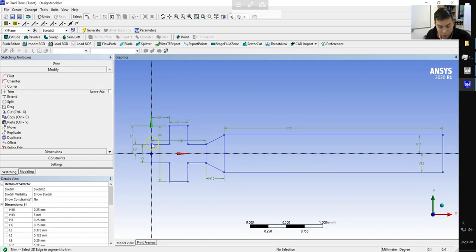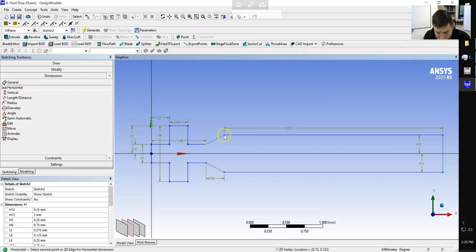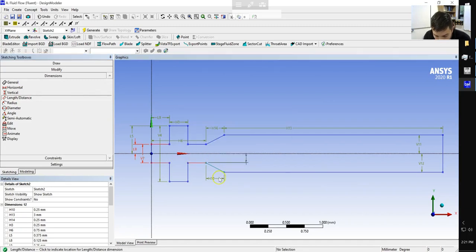Notice that everything is still blue, which means everything's properly defined dimensionally. Okay, still looking good. Now we do have a slight issue, because we've deleted some of our lines, we've lost some of the constraints. You could go back through and redefine the dimensions. I think the only one we have to do is constrain this distance horizontally. And I think the other one we have to do is constrain this distance vertically. I guess not, so we'll undo that one.